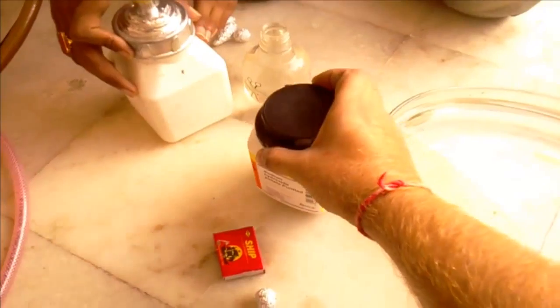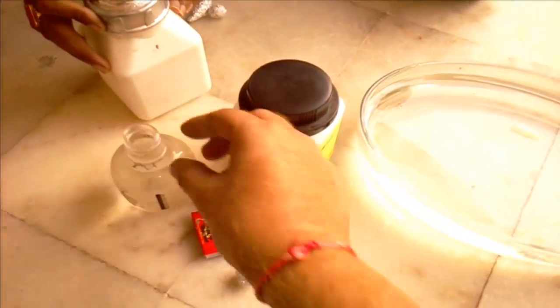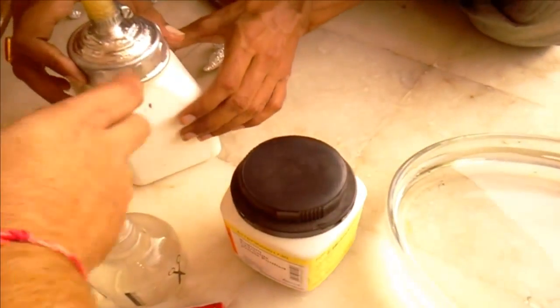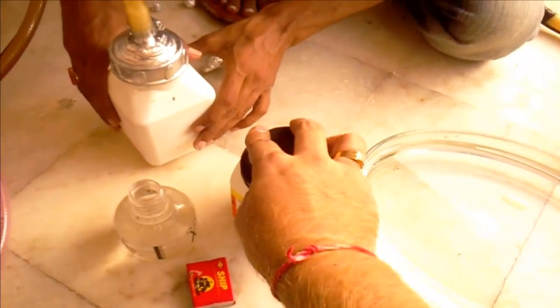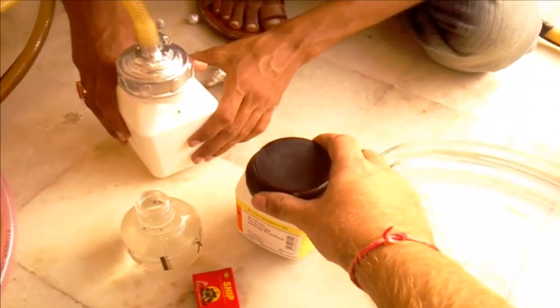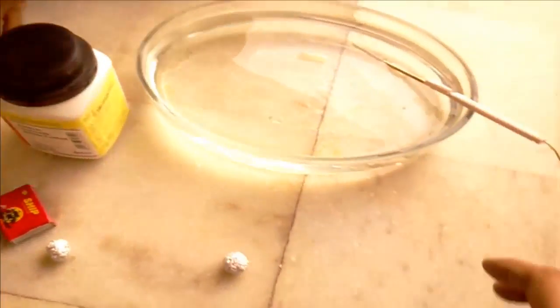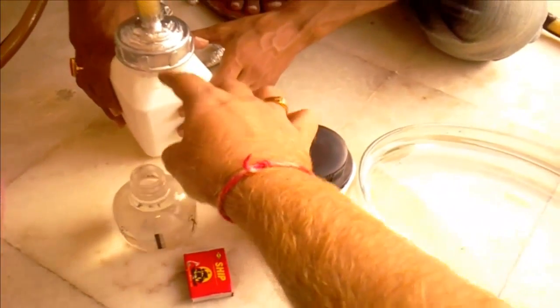This is sodium hydroxide and some water. This is deionized water for high conductivity, and this one is for cooling off this reactor. Because when I put some pellets in this jar it will get a bit hotter — maybe 60 to 70 degrees. To manage that, we are using cold water at a temperature of 18.6 degrees centigrade.